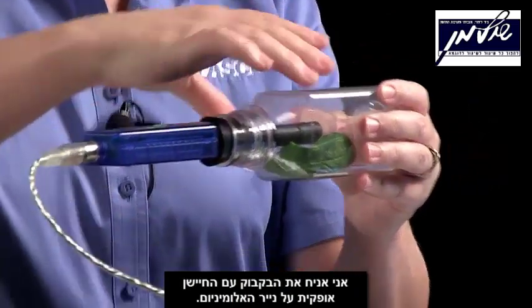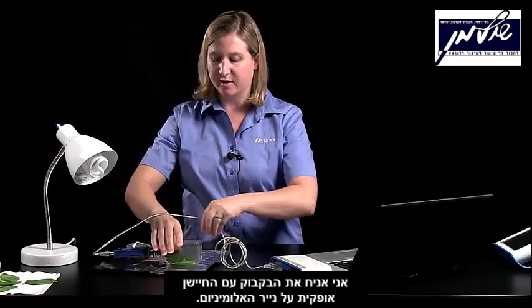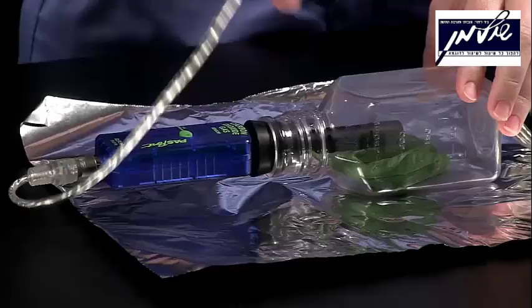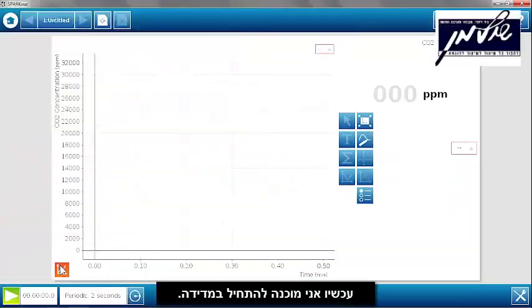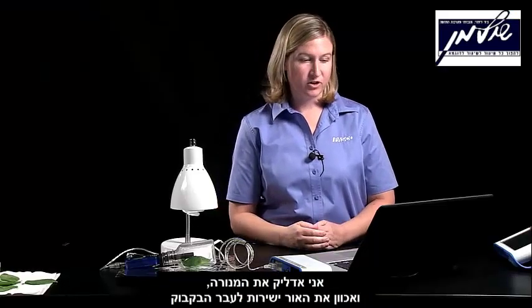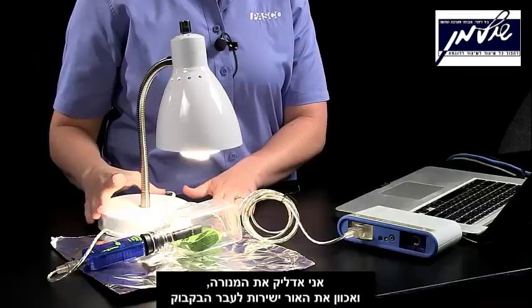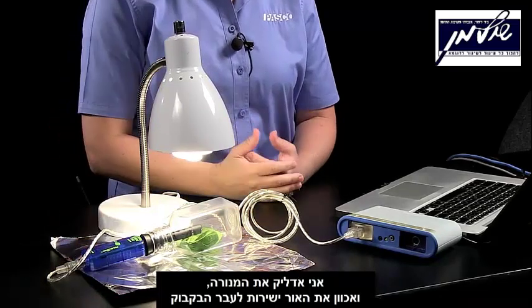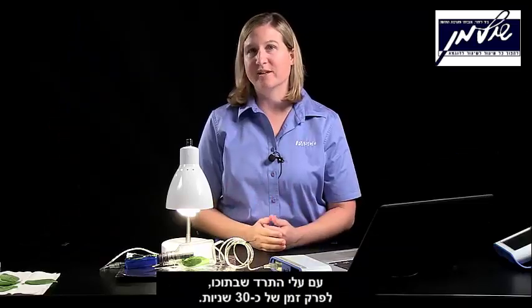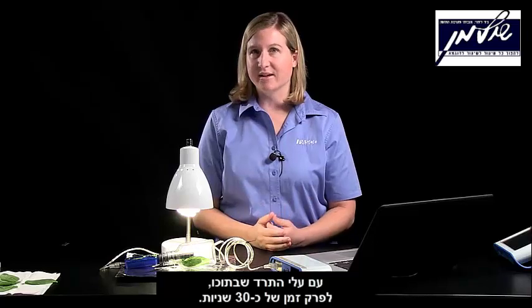I'll plug my sampling bottle — with the spinach leaves inside — with the carbon dioxide sensor. I'm going to place the sensor and the bottle flat on top of the piece of foil. So I'm now ready to begin data collection. I'm going to turn on the light and let it shine directly on the bottle with the spinach leaves inside for about 30 seconds.